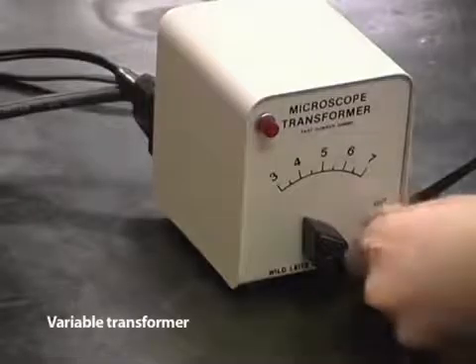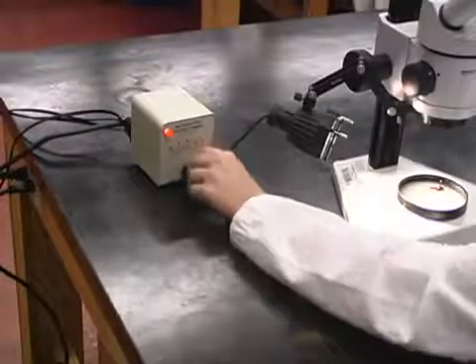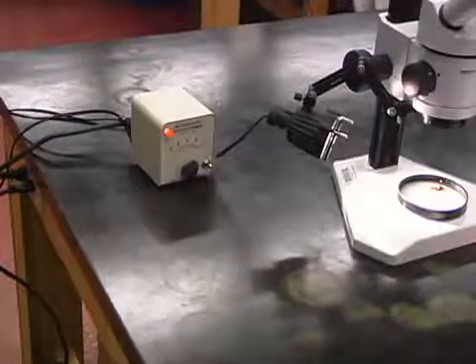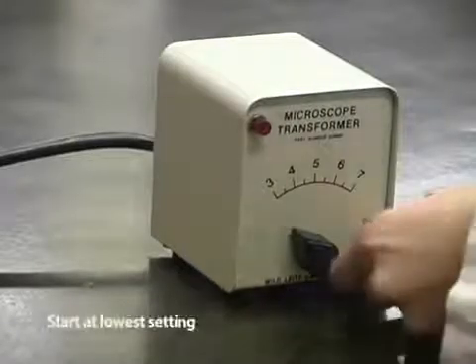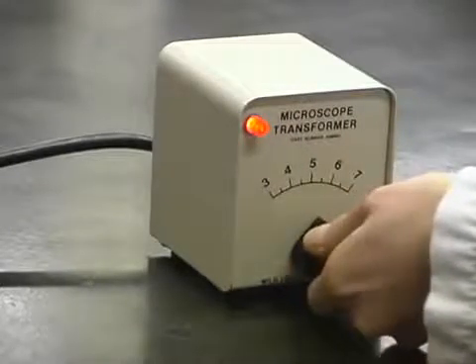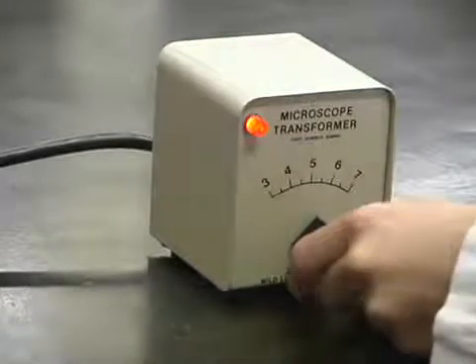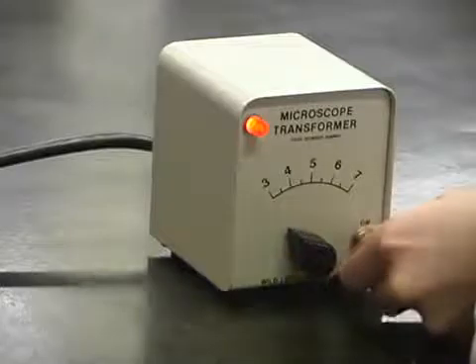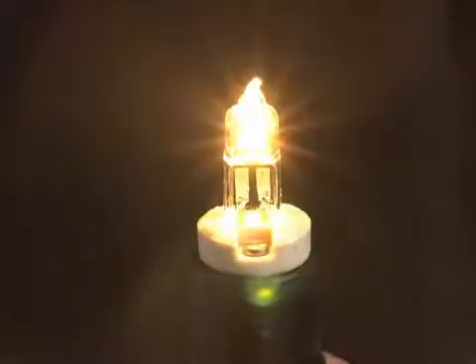Some microscope lamps have variable transformers that regulate the amount of electricity passing through the filament of the light bulbs and hence the light intensity. You should always start off with the lowest setting and gradually increase it to the point that the object is clearly illuminated and is still comfortable to your eyes. When you are finished using such a microscope lamp, you should turn the transformer to its lowest setting before it is turned off so that the next time it is used, it cannot accidentally be put into a high setting and burn out the light bulb. Microscope light bulbs are expensive.